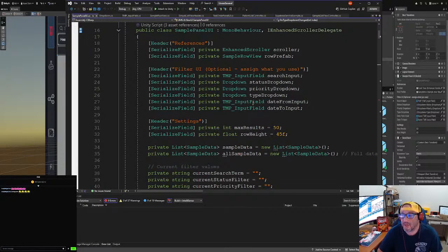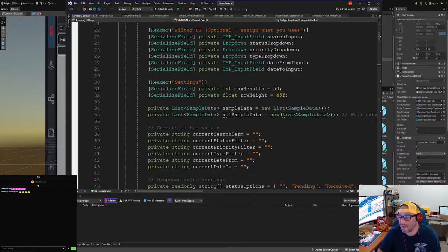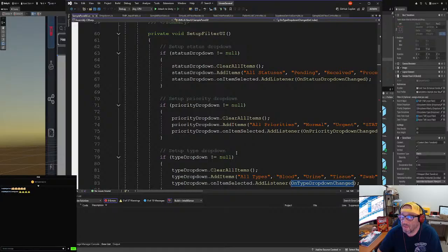Now, this is what we've got to do. We've got to build out this calendar stuff. This is actually an input field, but we have to make it into a calendar. Evo has some cool calendar stuff which is not native to Unity. You have to build it out yourself, so the plugin does that, and I wanted to take advantage of that. These are the strings, and this is the drop downs.